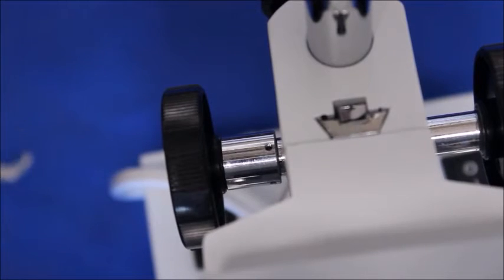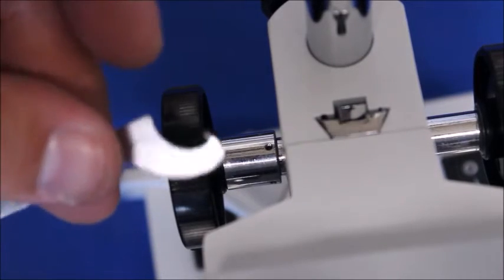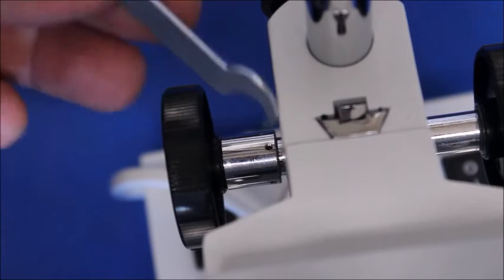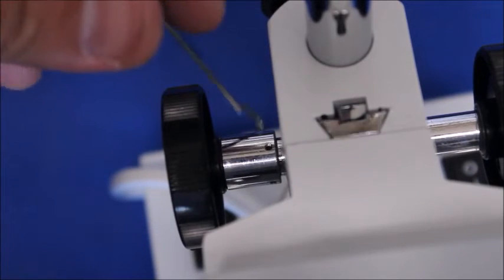Here's another one that requires a tool. This is a stereo microscope and they almost always come with the tool that they need. This tool has two different sides to it and you can see these little holes right here.